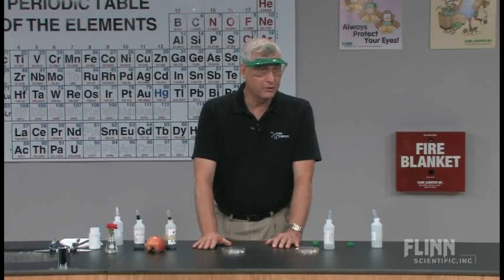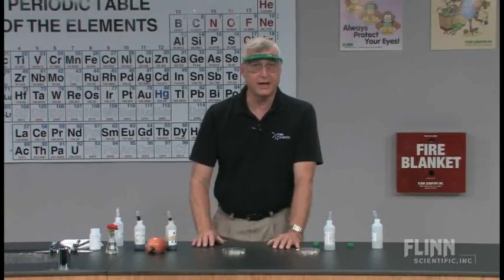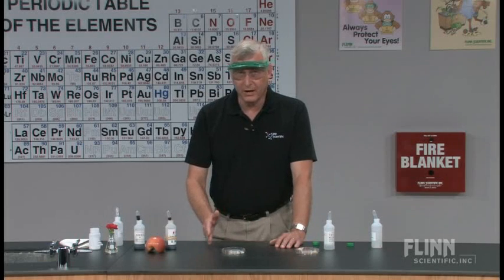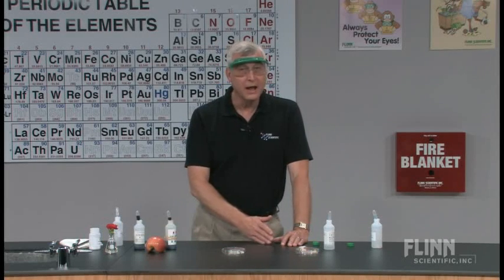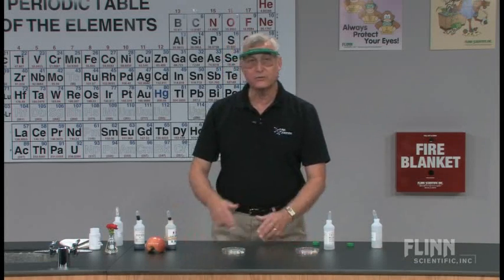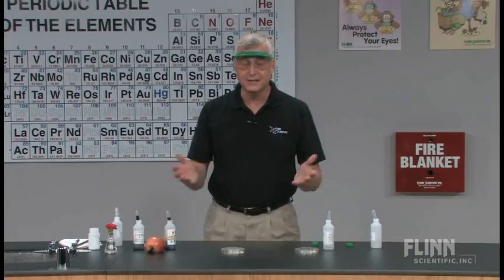A concept that is needed to discuss at this point is that the acid environment we are creating here is not the same as what we would find in our atmosphere. We have created a hugely concentrated level of acidity in this reaction plate, and it is not equal to the concentration of acidity in the air. You want to make sure you clarify that with students, because they are going to think that when acid rain is created from industrial or environmental processes it's as concentrated as what we see here — and it is not. However, neither do I have 15, 20, or 200 years to see the effect of that acid rain. So what we've tried to do is speed up the process in a time-lapse kind of way, with a highly concentrated acid rain environment, to see what will happen in a class period versus letting this run over a period of many years.